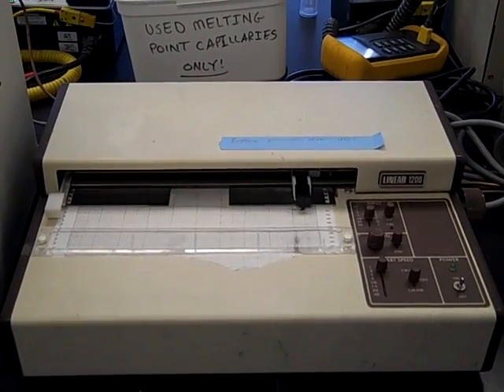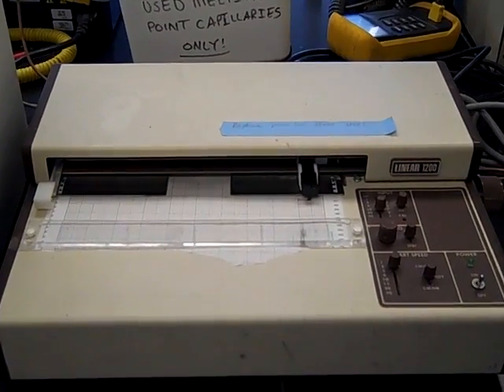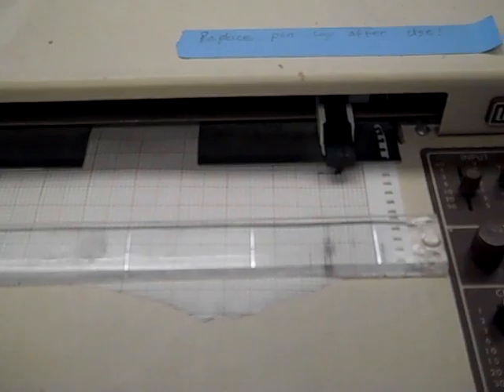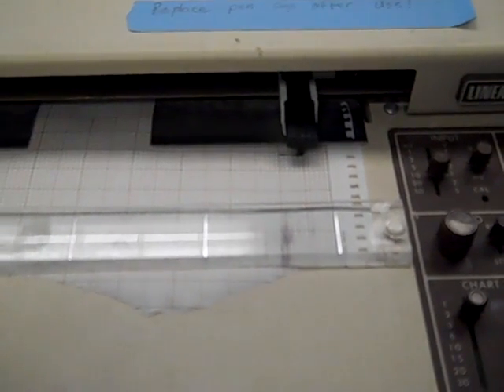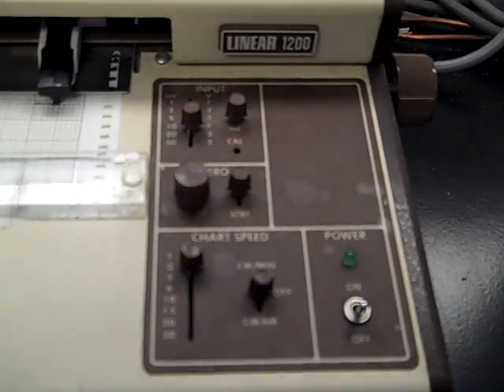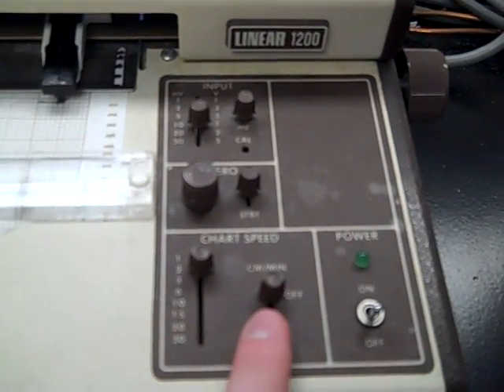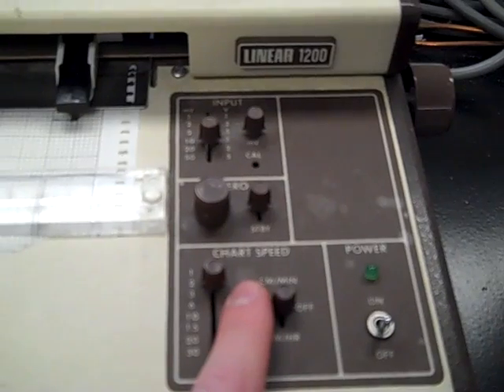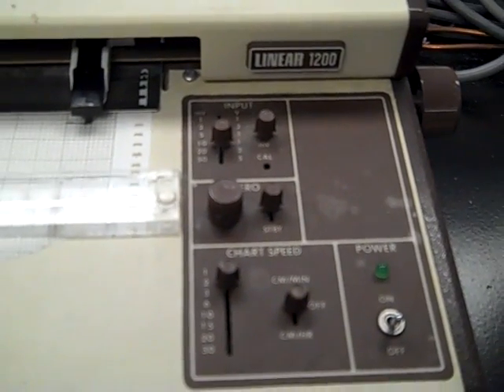If your lab is in LD202, your plotter will look like this. You can see the graph paper and the pen. This little plastic edge helps you rip off the paper. And then the controls over here. The only one that you'll need to worry about is off to centimeters per minute. Everything else should be set for you.